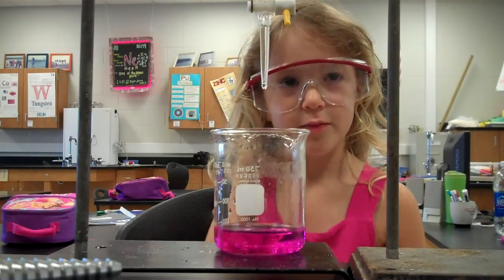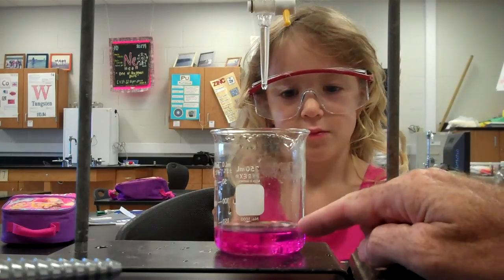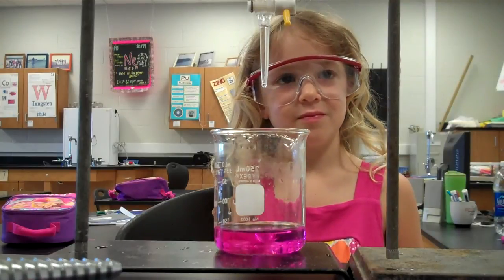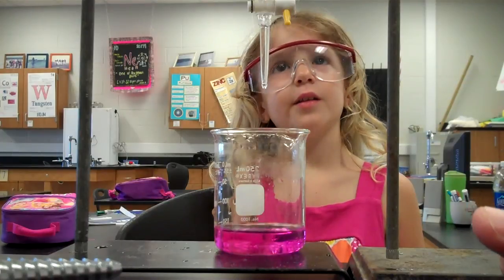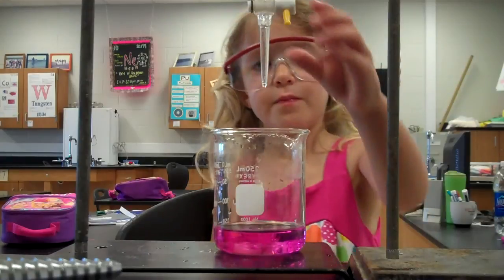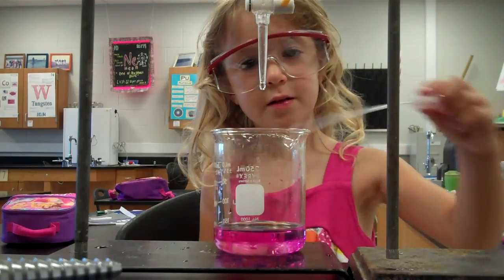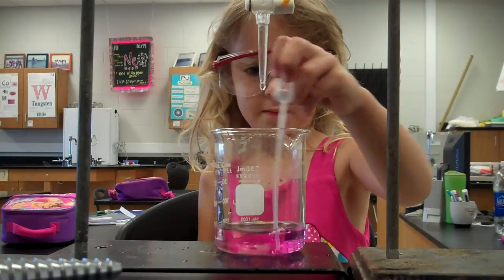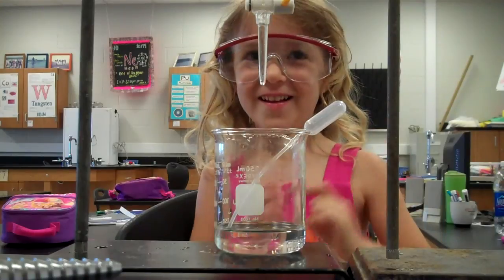Do we have to mix it now? Well, we'll wait a little bit. We had some sodium hydroxide in here and it's a base — that's why it turned pink when I put the phenolphthalein in there. And we're putting some hydrochloric acid in there, which is very, very weak. Now the base and the acid we have mixed in there is weaker than orange juice and coffee, so nobody can get hurt. Now it has changed colors. Good job.